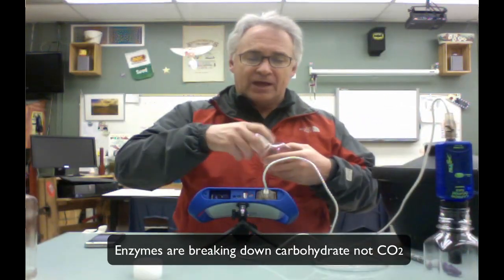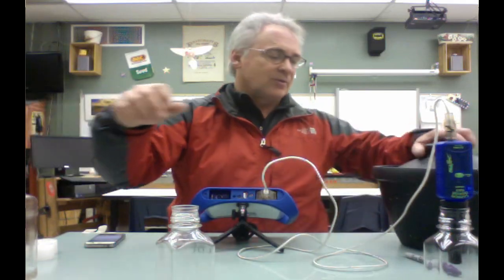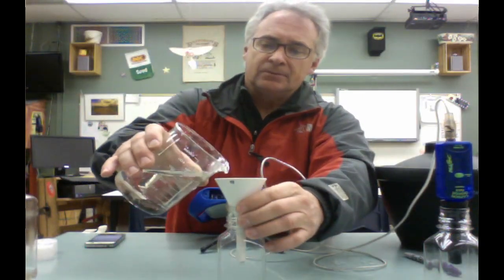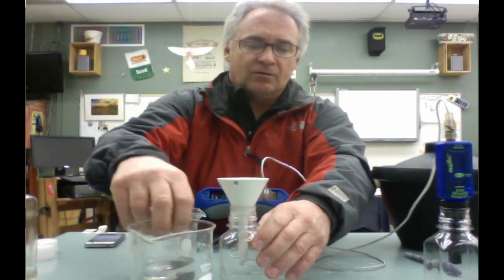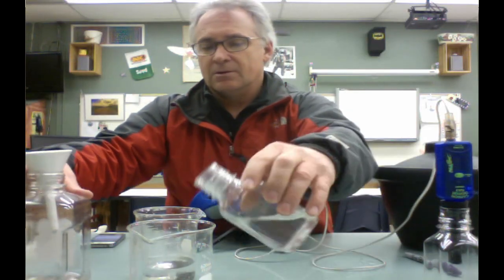As you are waiting for that to run, you're going to get your other collection bottle. And for this collection bottle, you're going to be getting out the cold seeds. Again, same thing. They've been put in water for 24 hours. Let's set that over here for now.